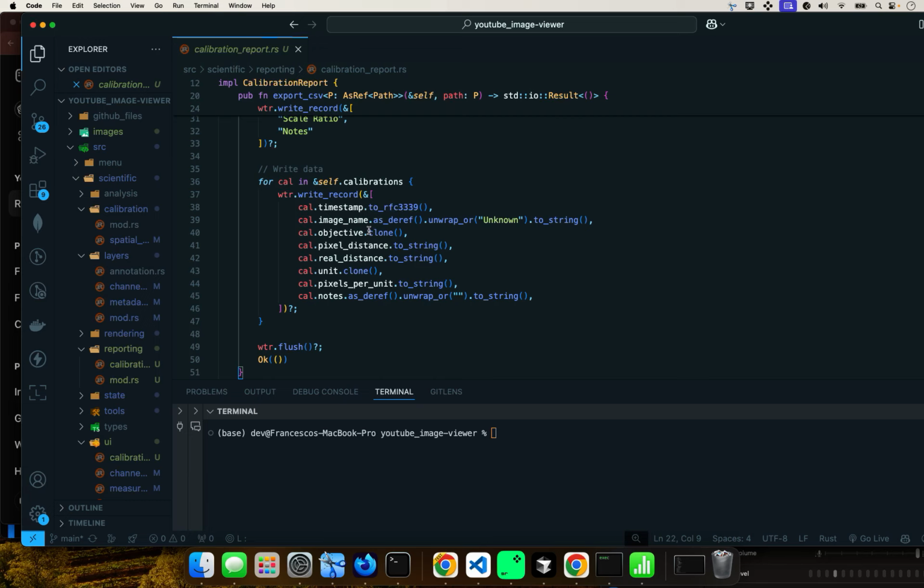Basically, it's going to iterate through the calibration data, and it's going to write everything into a CSV file. This is converting the timestamp to ISO 8601. This has to do with the UTC, with the chrono library. Here it is extracting a reference. So if it finds that for the image you didn't put a name, it's going to default to unknown, as I showed you before.